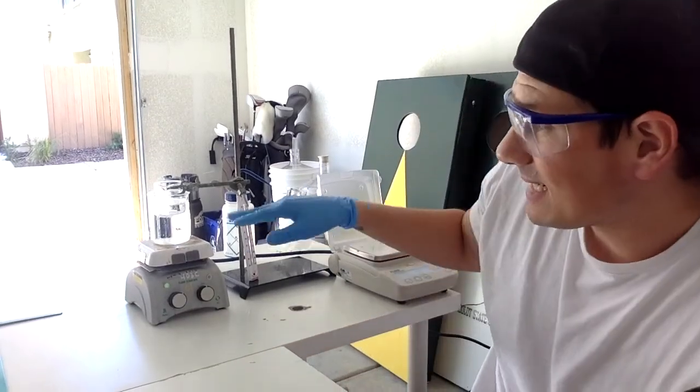for about 10 minutes. So as it's sitting in that hot water bath, I don't want it over the flame generally. I'm just going to have it in that bath so that the warm water will make the reaction go faster, and it'll kind of like liquefy anything that's in there. So I can already see that the reaction's kind of coming together. It's going to take 10 minutes, so I'm going to pause here, and then we're going to come back. All right, you guys, we're back. So it's been 10 minutes of heating now.